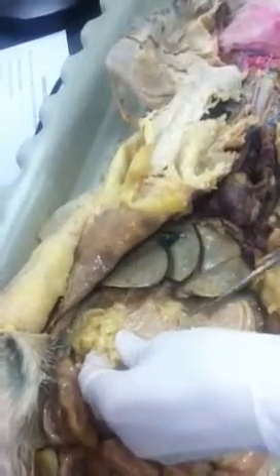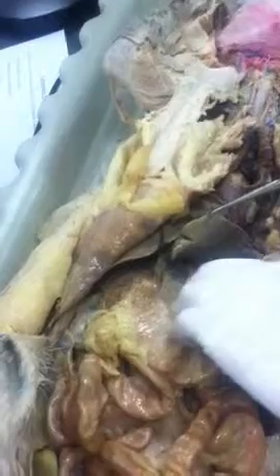Okay, so this is the stomach, this whole organ here. Okay, so the body of the stomach is the corpus. The part that is up by the cardiac sphincter is the fundus, and then the lower part is the pylorus. What does the stomach then connect to? The small intestines. And what's the first part of the small intestine?